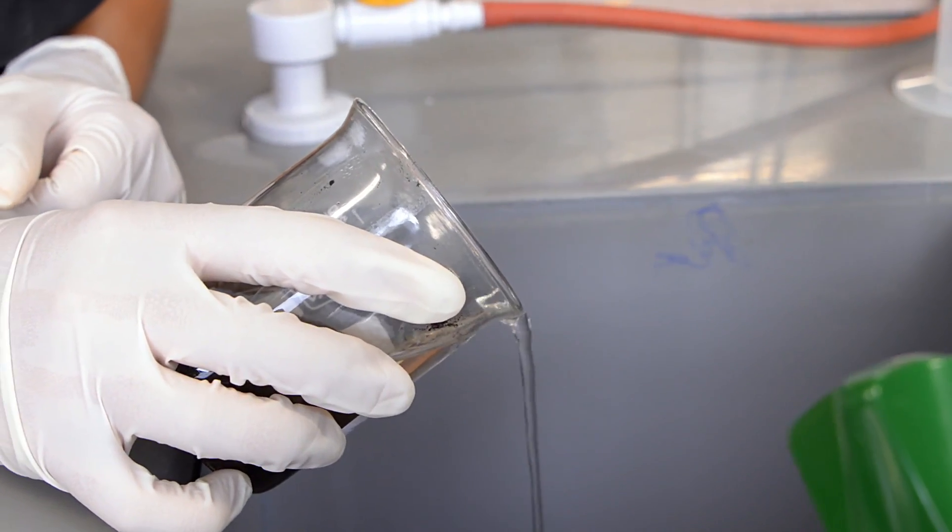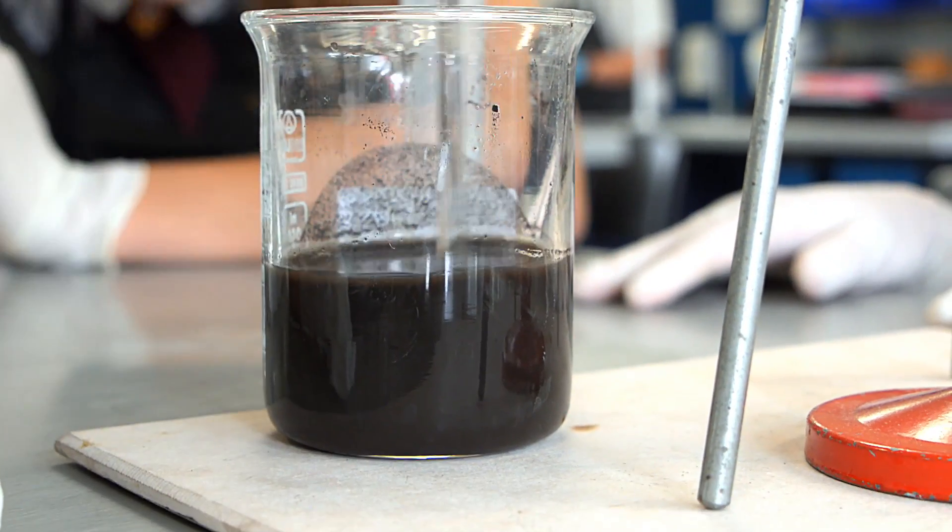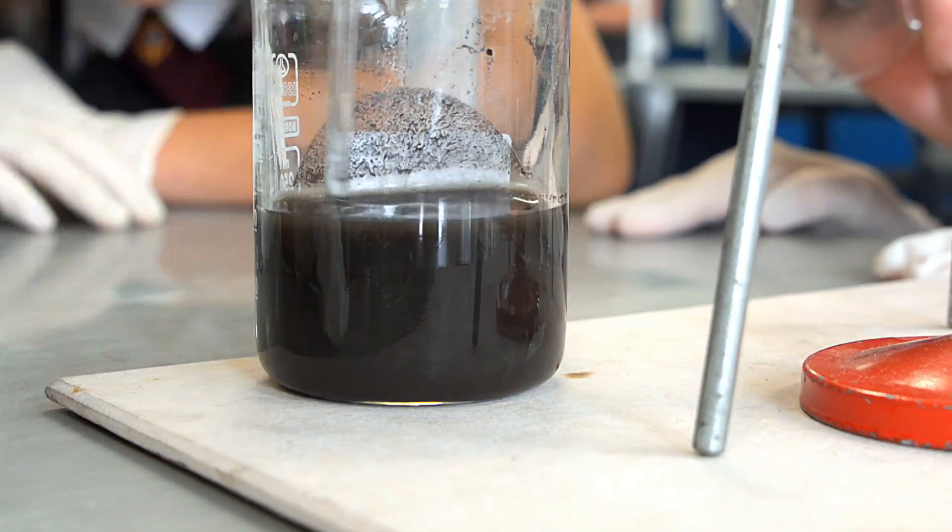After the black solid had been decanted a few times, 50 mL of 3 molar sulfuric acid was added.